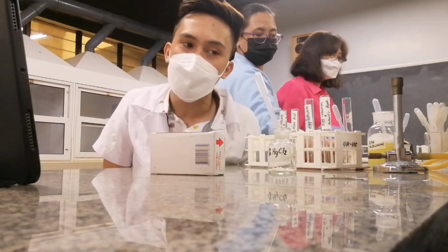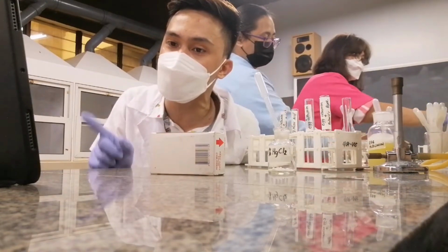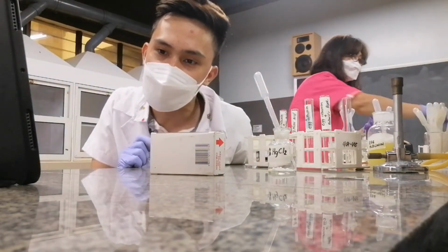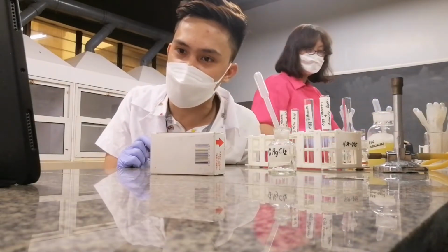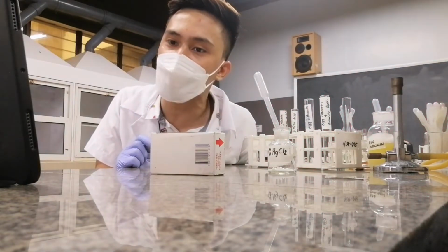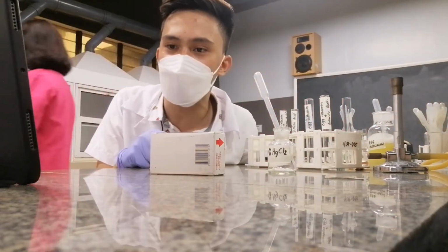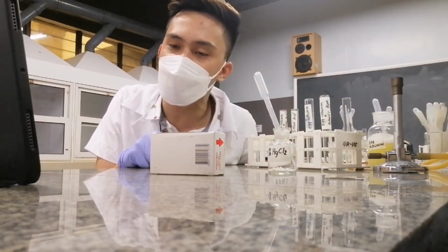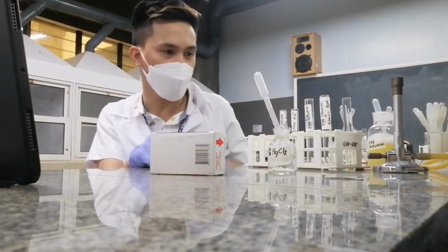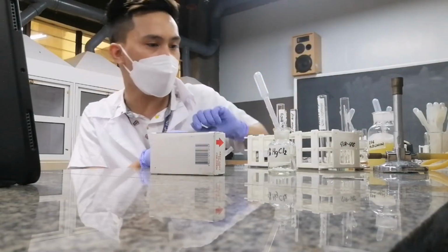Any question so far? So what did we see already? We saw that your protein is coagulated by heat. And how about your alcohol? Can it coagulate or precipitate? Okay, it can also coagulate. And then your heavy metals can precipitate. Okay, very good. So now, let's try the effect of your strong mineral acids.